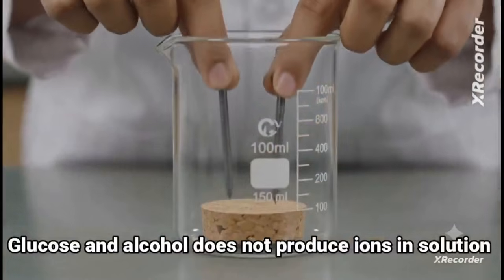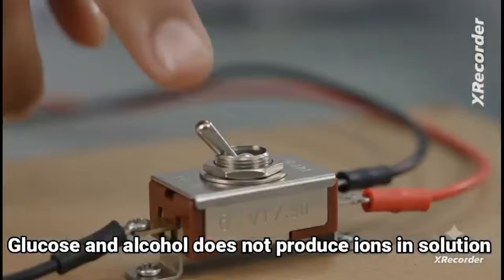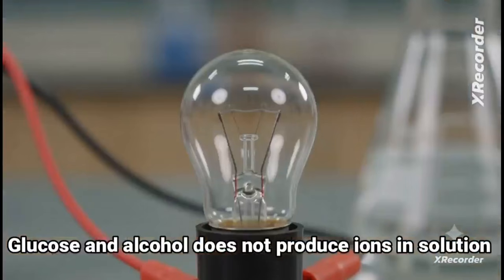Fix 2 nails on a cork and place it in a beaker. Connect the nails to a battery, bulb and switch. Pour glucose solution. Now switch on the current. Observe that the bulb does not glow.